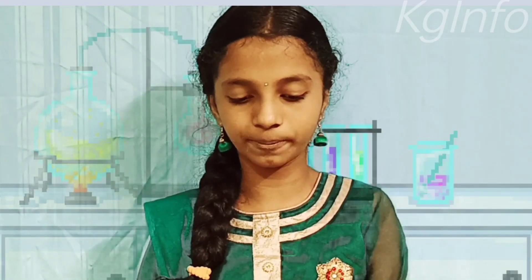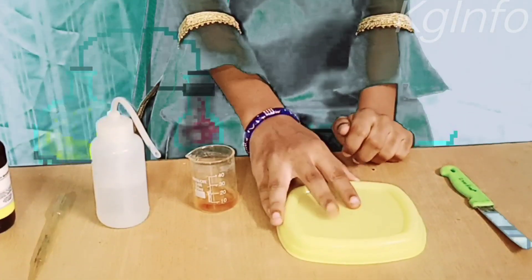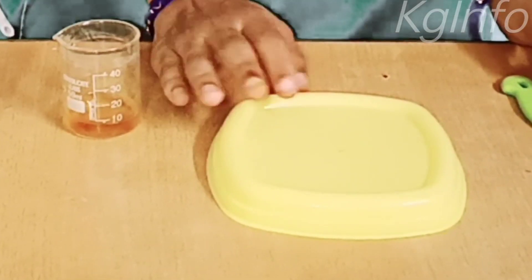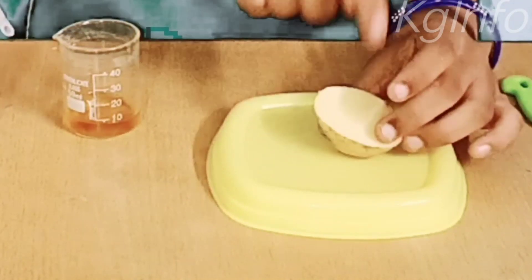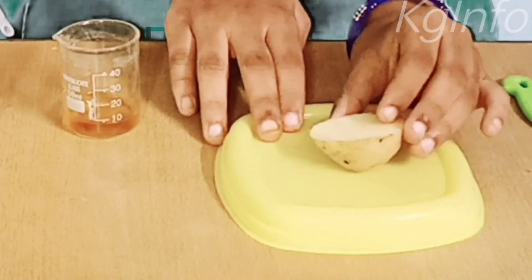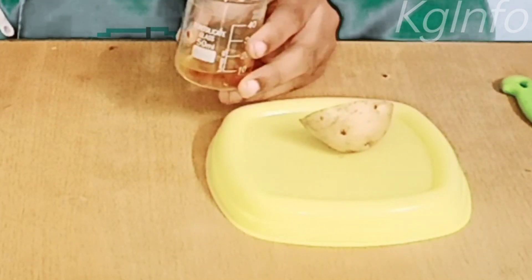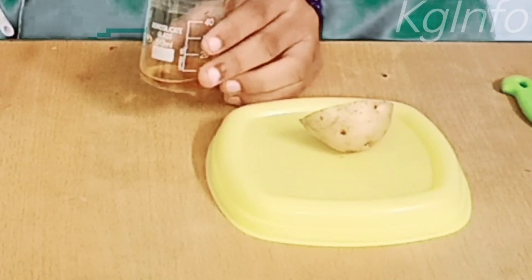I took a small potato piece and placed it on a plate. Now with the help of the dropper, I will add 3 to 4 drops of diluted iodine solution onto the potato.